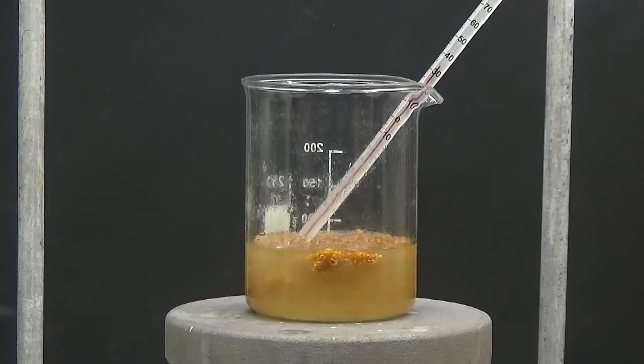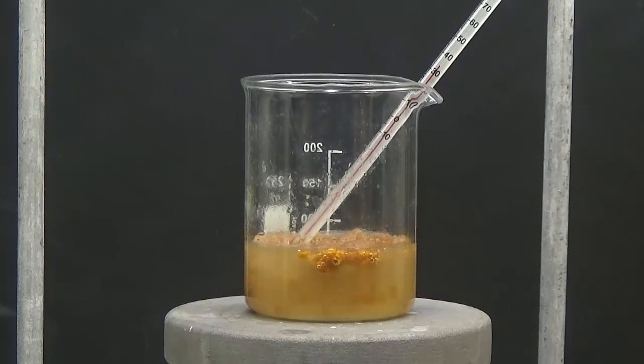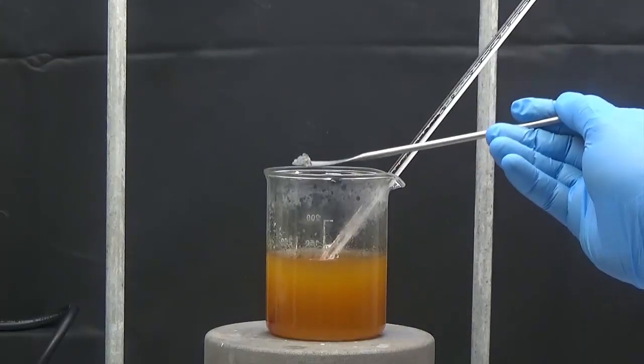In this video, we will look at how to obtain furfurylamine from furfuraloxime in one operation.